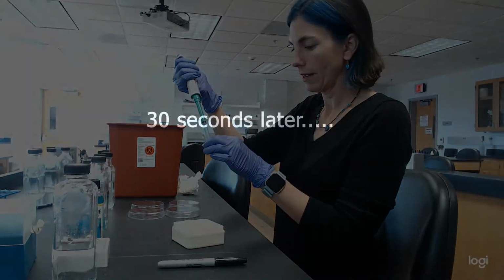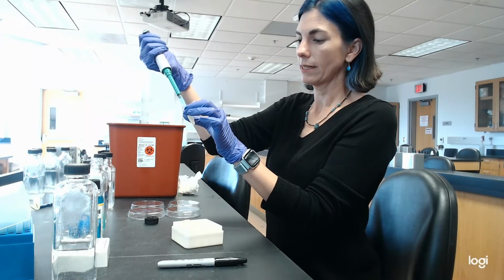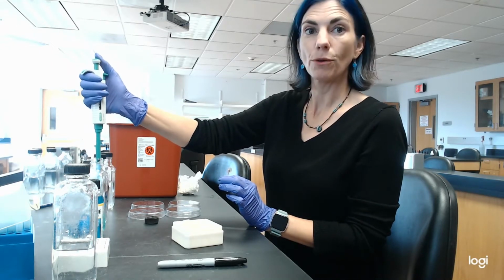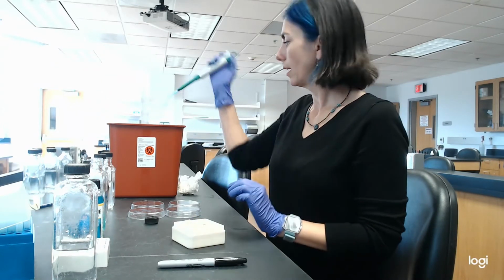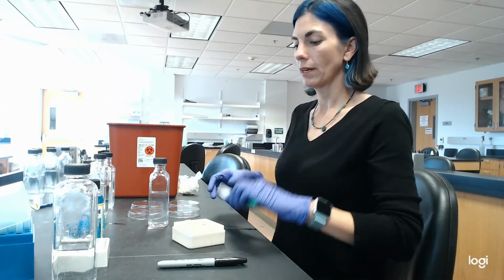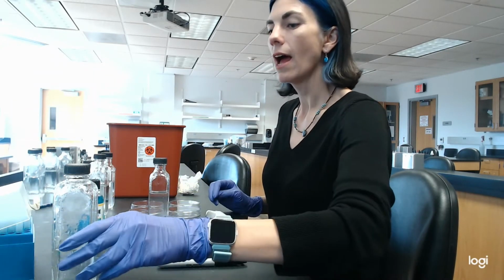Okay, so it's been 30 seconds. Let me take out 1 ml and go ahead and dump it into bottle A, as shown here. Okay, now once I've done that, I've moved it into bottle A.